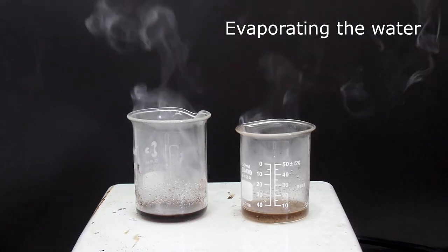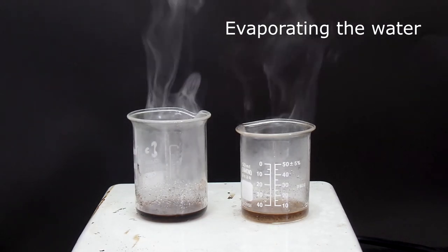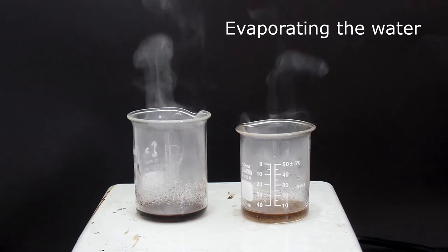After one hour of heating at 180 degrees Celsius, water did evaporate but not that much, so I just proceeded with the experiment.